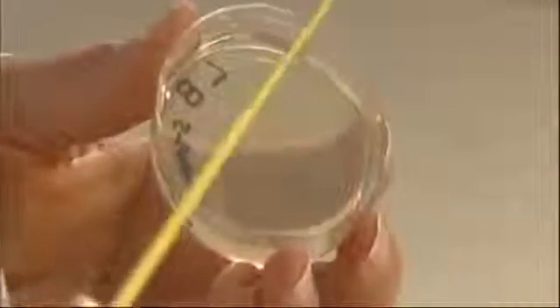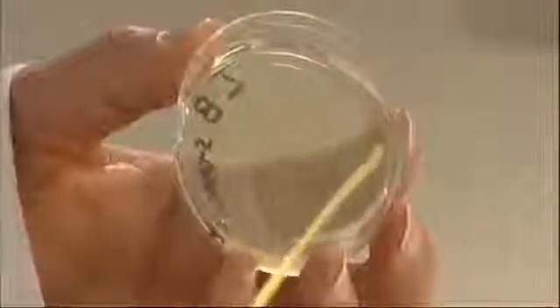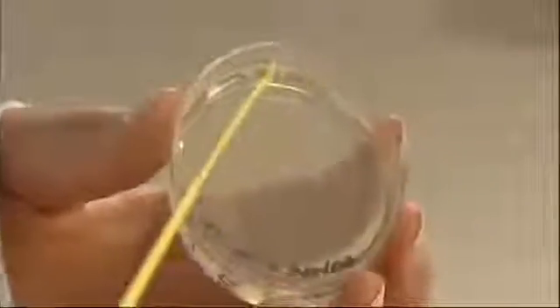Give the plate a quarter turn and draw ten lines starting from where you left off. Give the plate another quarter turn and repeat.